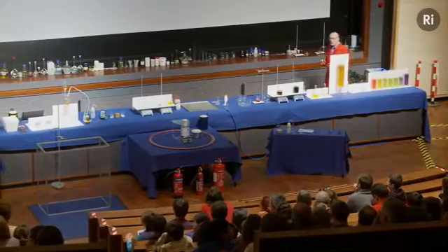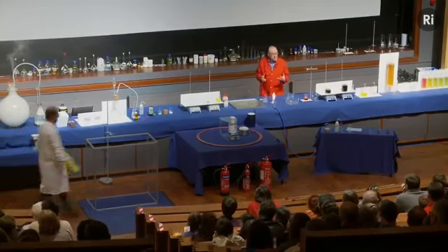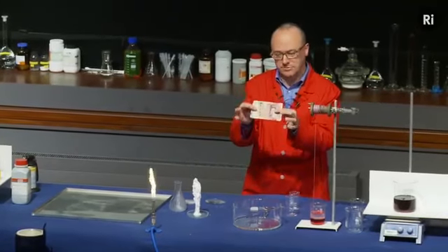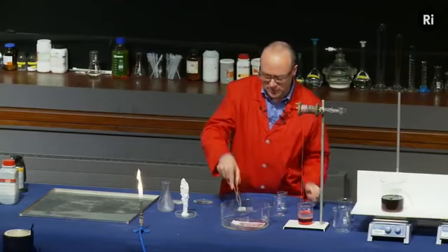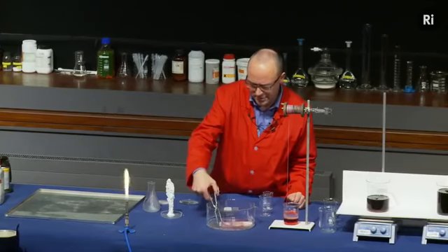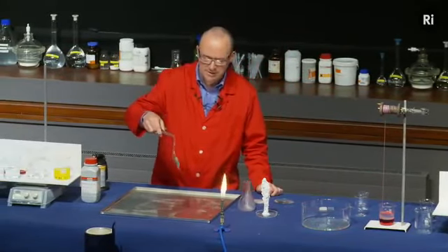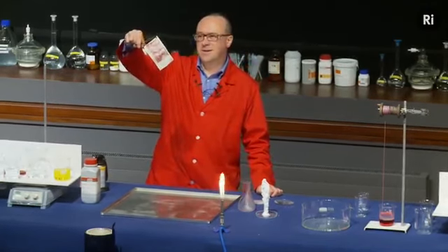So we've seen a couple of reactions there that involve effectively combustion. And combustion can give rise to some very interesting chemistry. And for this, I'm going to set fire to a brand new £50 note as an example of combustion. So let me soak the £50 note in some flammable liquid. And then we'll set it on fire. So this is my £50 note. It's brand new. And there it is on fire.